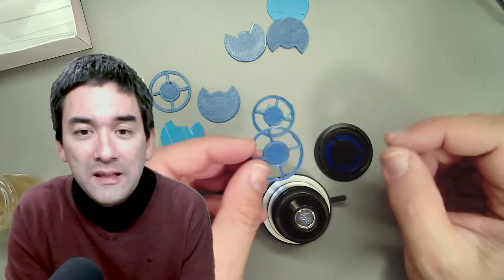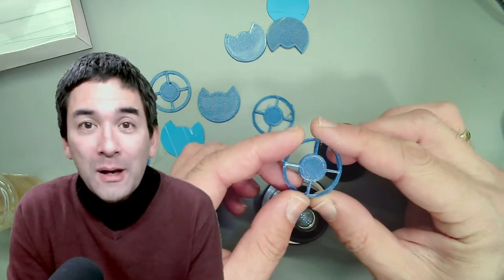Hello everyone, I hope that all of you are able to hear me, and welcome to another microscopy live stream. Today I would like to talk a little bit about some alternative lighting techniques, like using oblique illumination and dark field, and I would like to simply show you a couple of things that you can do with that.